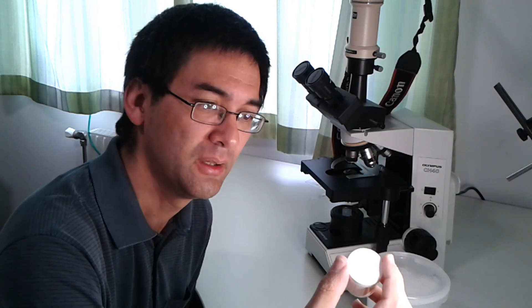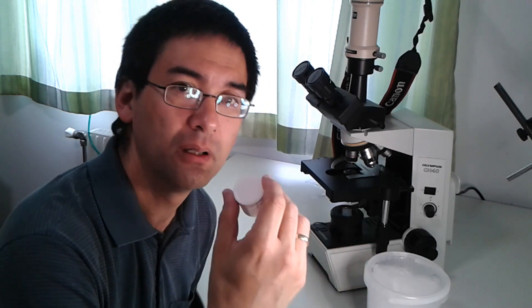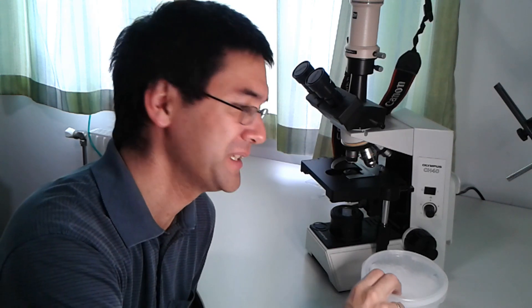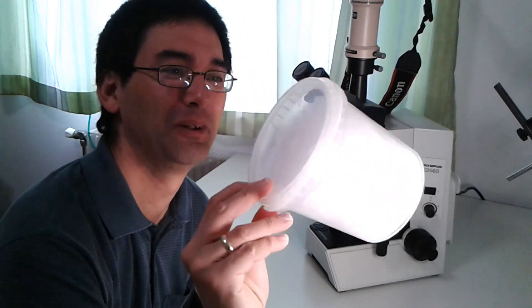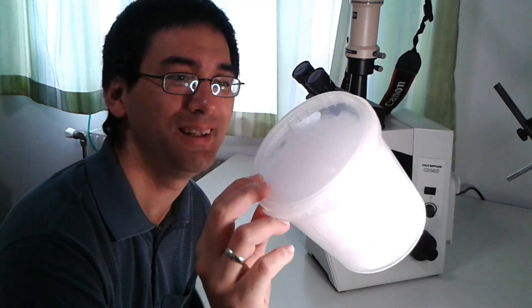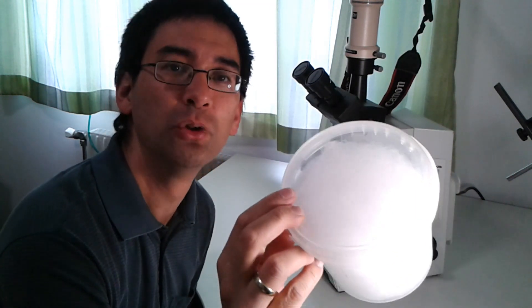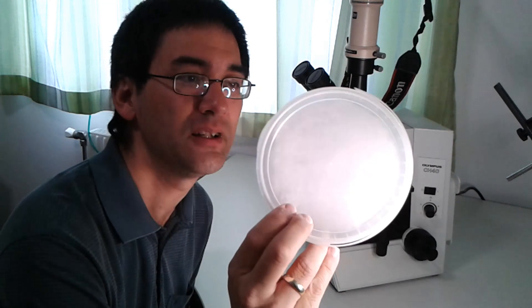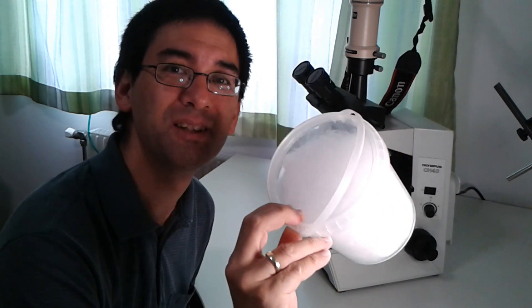But luckily we still have some sample material left over because I bought myself a little bucket with cotton candy and kept it closed so that no moisture can enter. I'm going to use this one right now to observe.